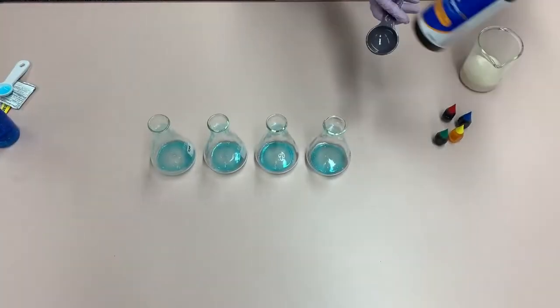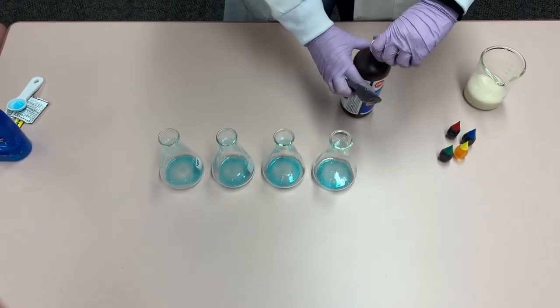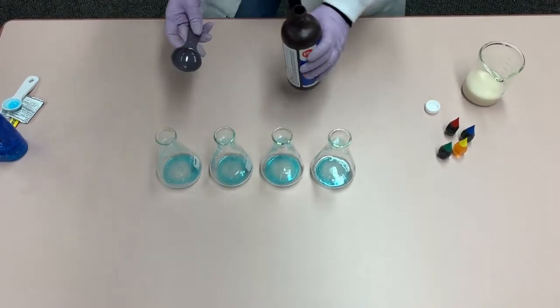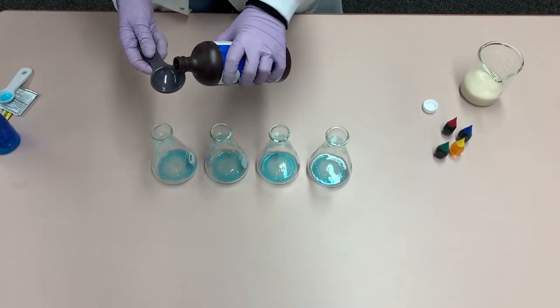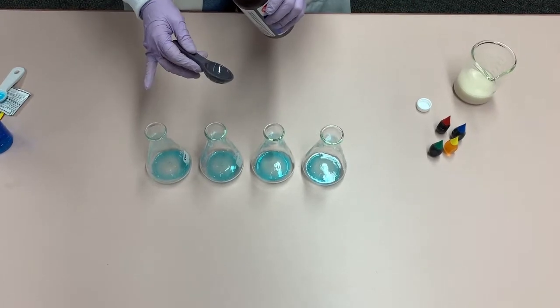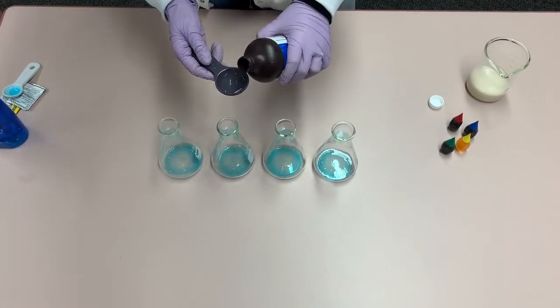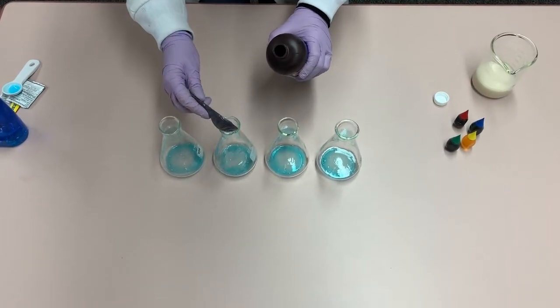Next, we take our three percent hydrogen peroxide and add varying amounts to each flask. To flask one we add no hydrogen peroxide, and to flask two we add half a tablespoon.